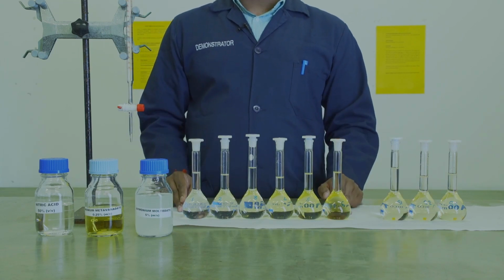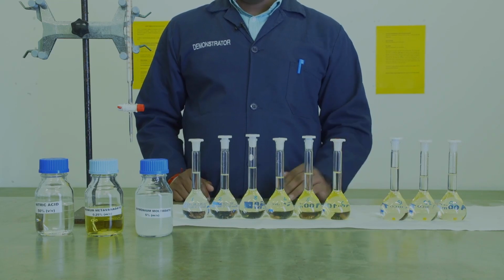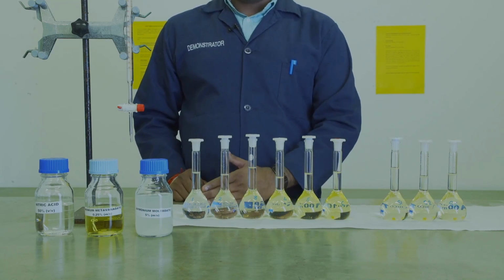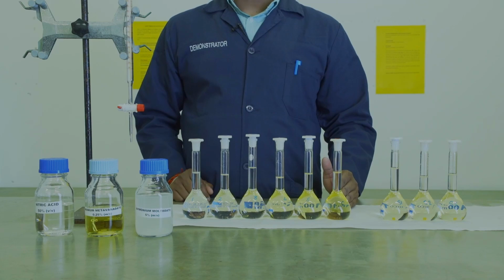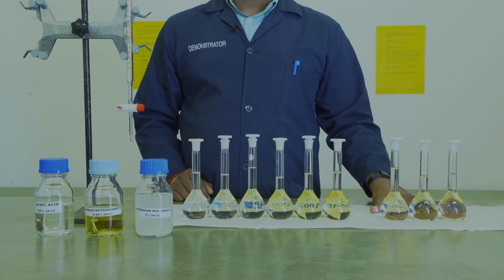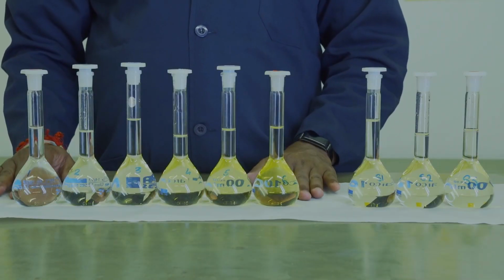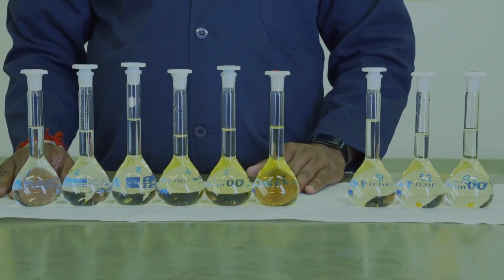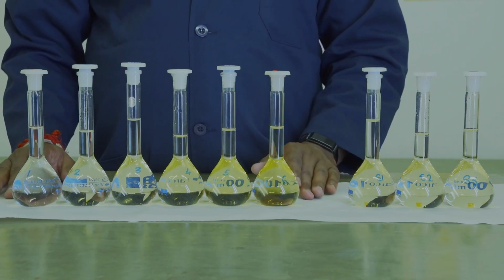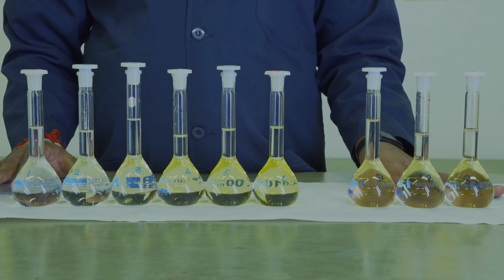You will have 6 standards and 3 samples of cola. You should note an intensity increase between standard 1 and 6 in terms of the yellow color. Your samples should essentially be the same color in intensity. You should have 6 solutions increasing in intensity of the yellow color. These are your standards. You should also have 3 cola samples which have the same intensity of the yellow color.